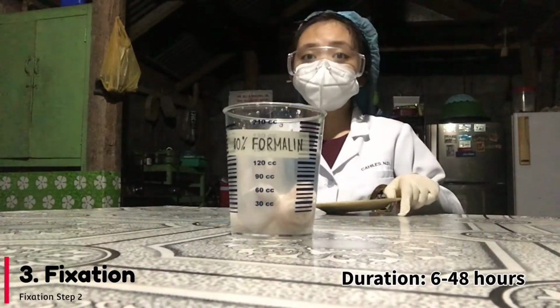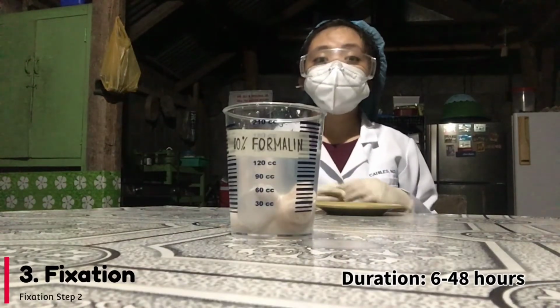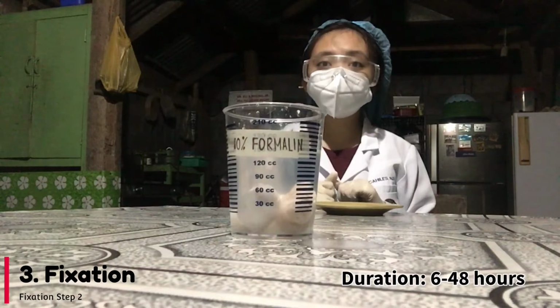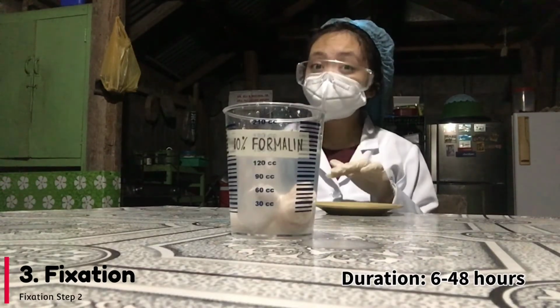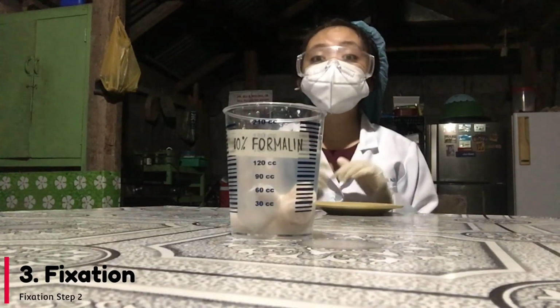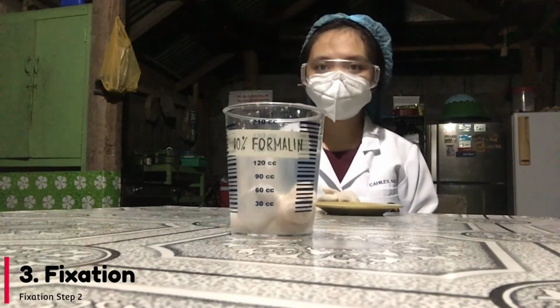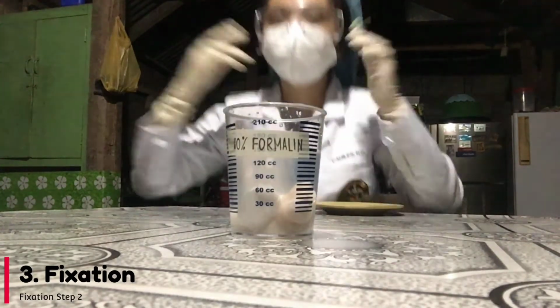This process is very important because it prevents autolysis of our specimen. Also, if this process is delayed or performed wrongly, it can cause irreversible damage to our specimen. That is all. Thank you.